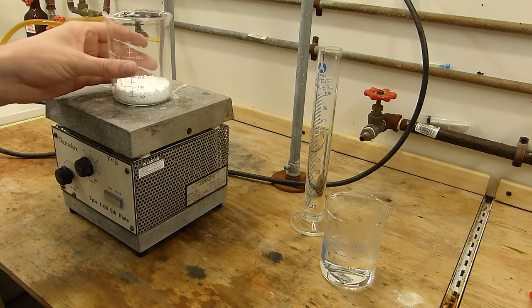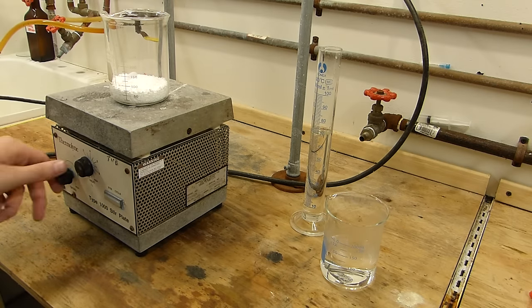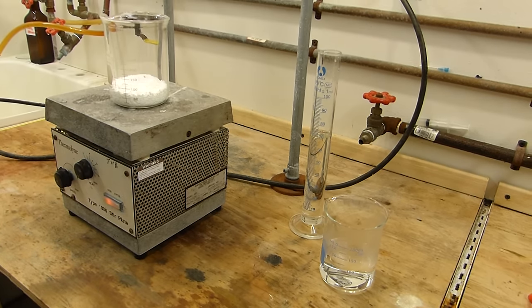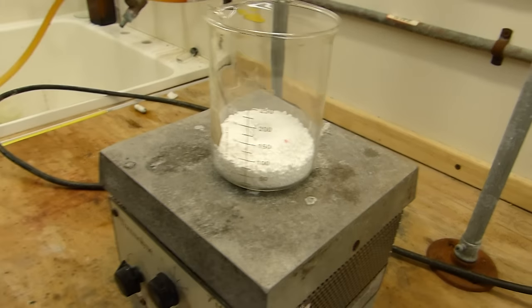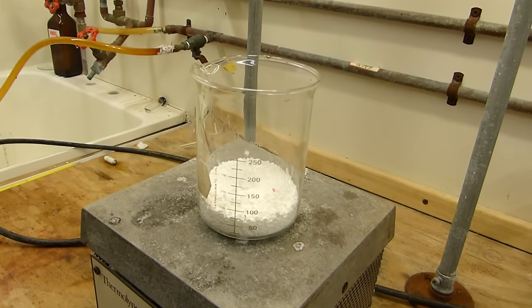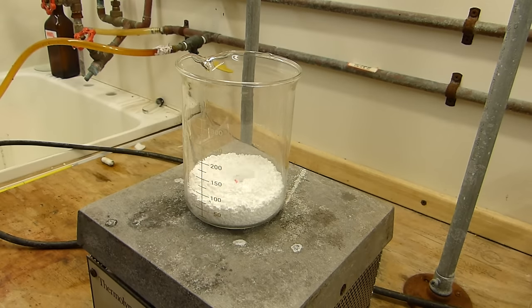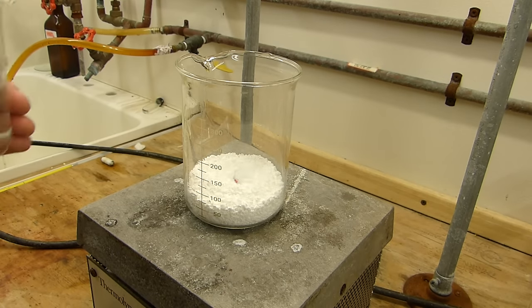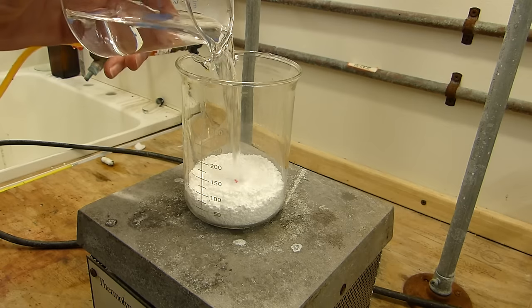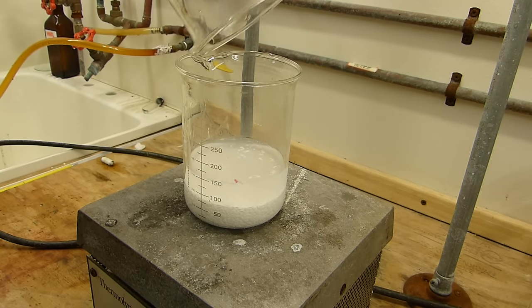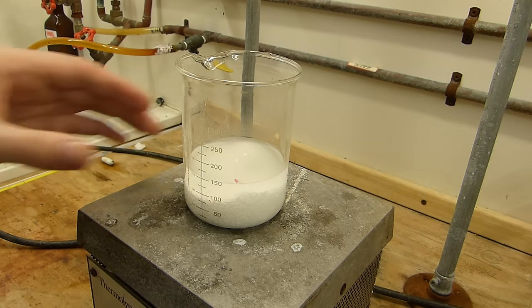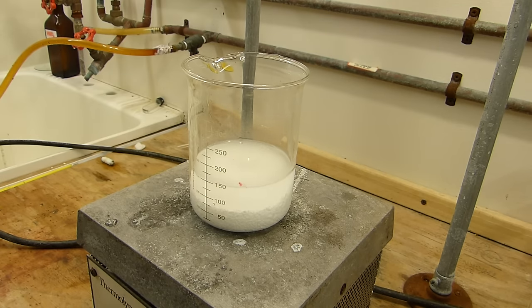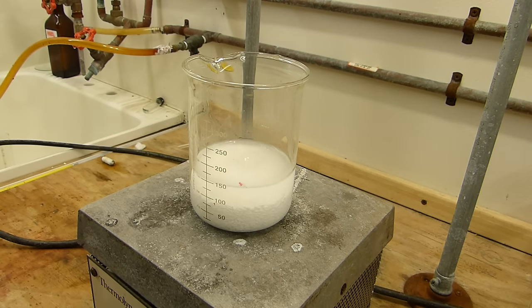So I'll put this on the hot plate with a stir bar and look at that stirring. Then we can add the hot water here. And we'll simply stir that until it's dissolved.